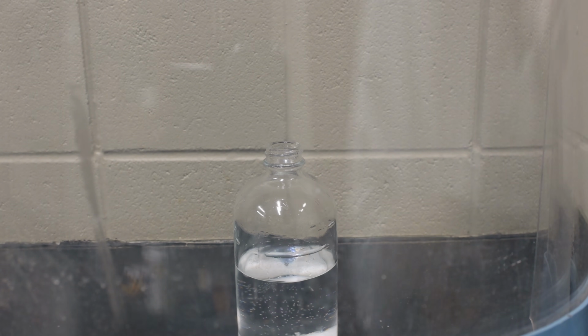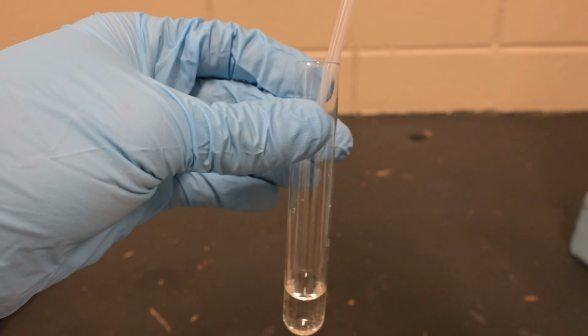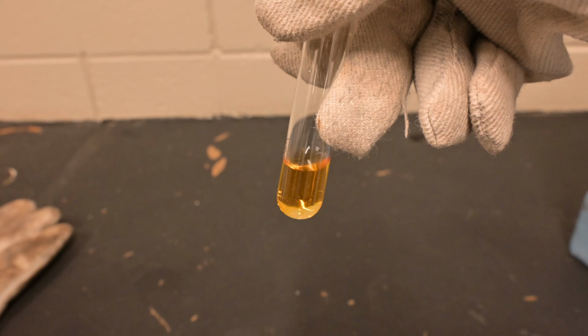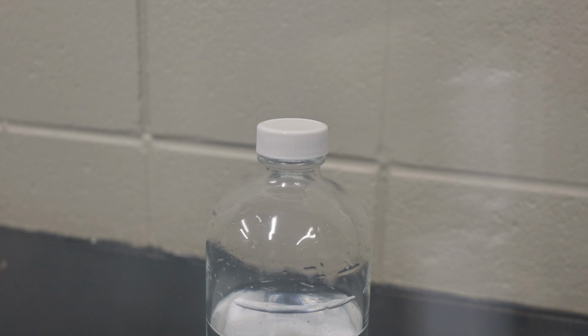Using a pipette, I carefully removed a small sample of the ether and added it to a potassium iodide and acetic acid solution. This is a peroxide detecting solution. The resulting color change to yellow confirms the presence of a dangerous peroxide. At this point, I recognized that handling this bottle any further was beyond my comfort zone. The situation requires professional disposal, so I promptly handed it over to experts trained to deal with such hazardous materials. This also means I need a new solvent.